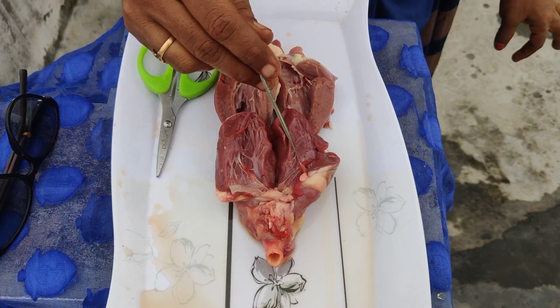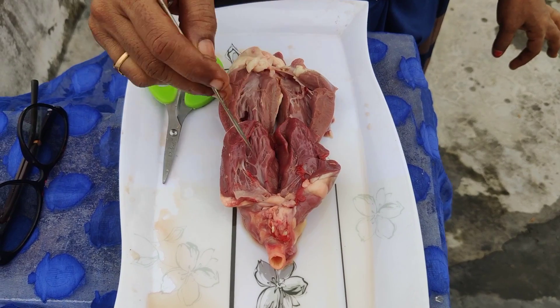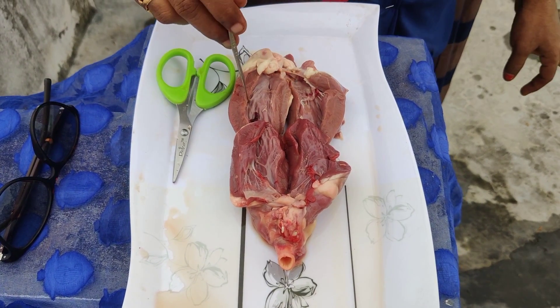There are four chambers in the heart — these are the auricles and these are the ventricles.